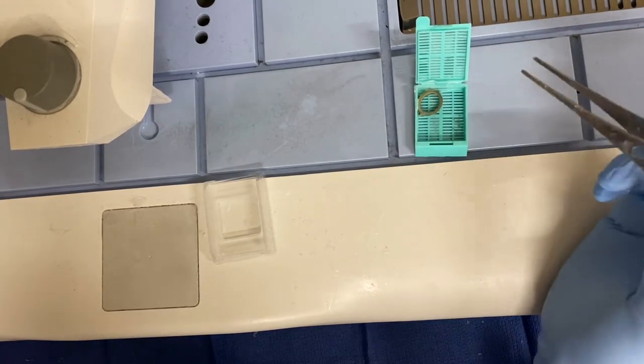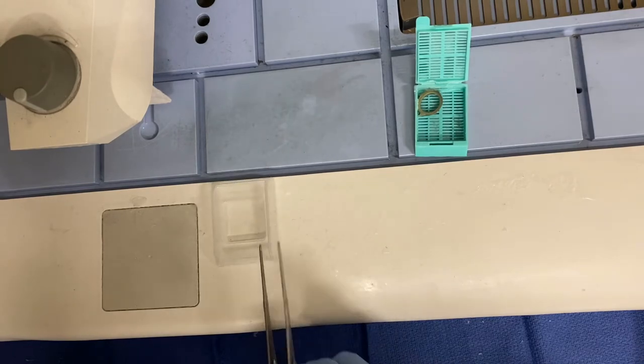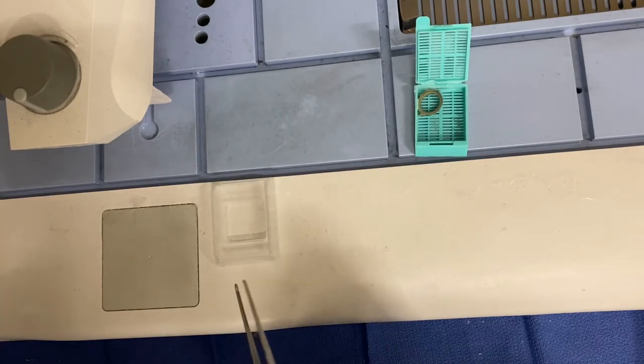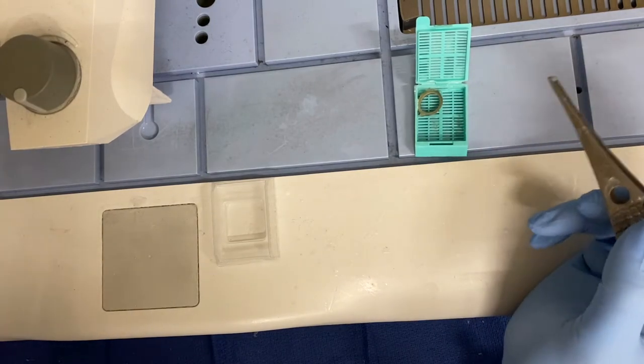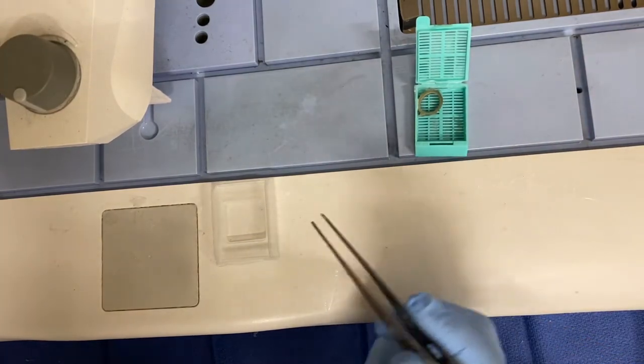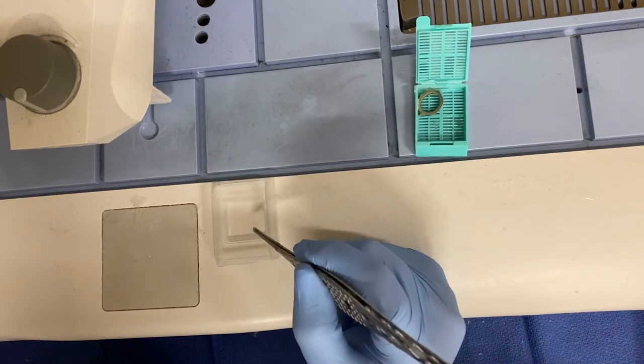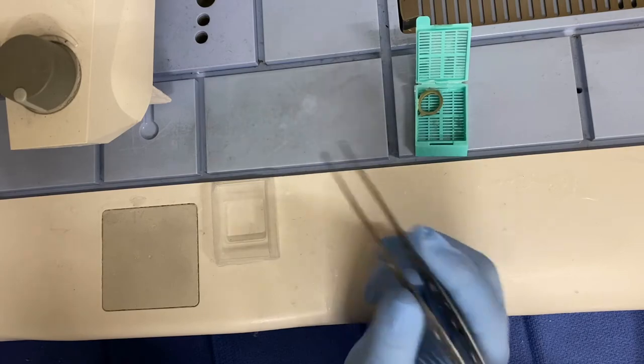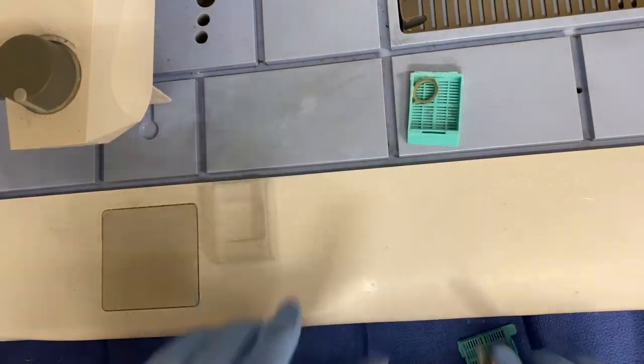Then you're going to select the most appropriate mold. We just have one size mold in our lab, but if you have small biopsy pieces of tissue, you're going to pick a much smaller mold. You want to ensure that your tissue is going to be completely surrounded by a rim of paraffin once you have embedded it. So you can break the lid off of your cassette.